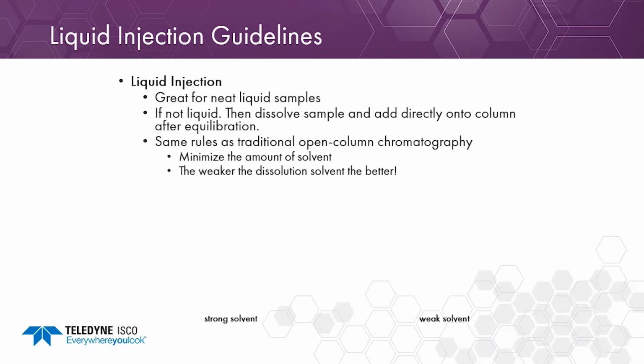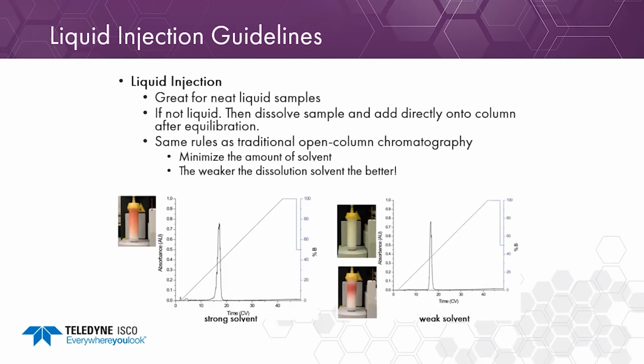Same rules as traditional open column chromatography. You want to minimize the amount of solvent because that's going to be your inherent band width. And the weaker the solvent, the better. Here is an example of a strong solvent versus a weak solvent. You can see the band broadening from the strong solvent, both visually and in the chromatogram, versus the weak solvent. This is a C18 column, and this was loaded in alcohol versus the water solvent. Keep in mind the water is able to dissolve it though.